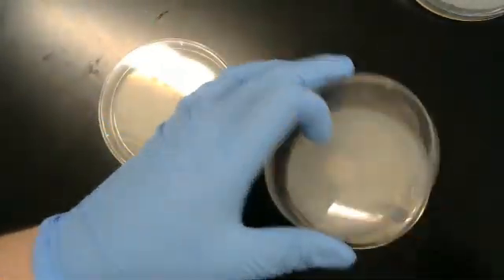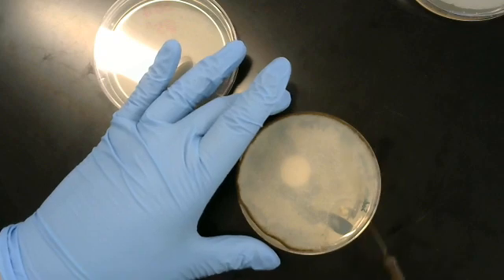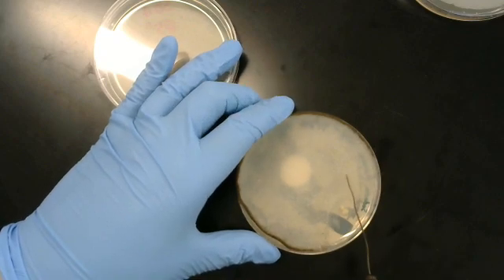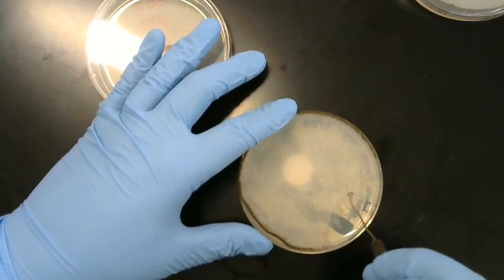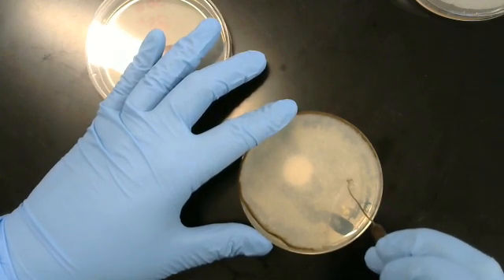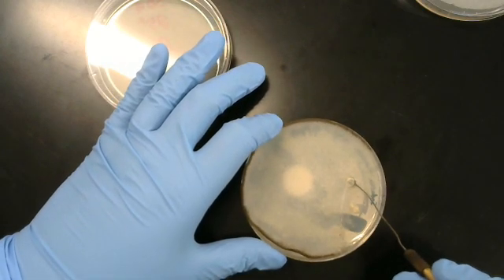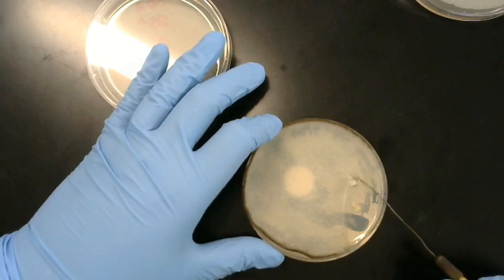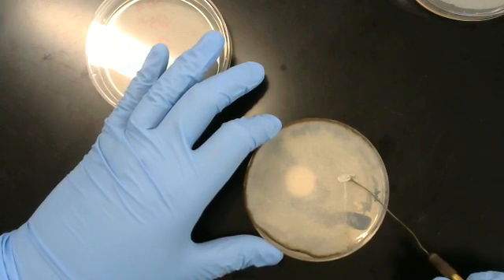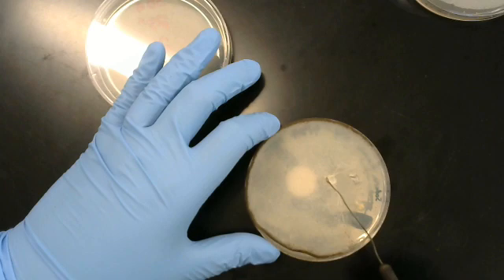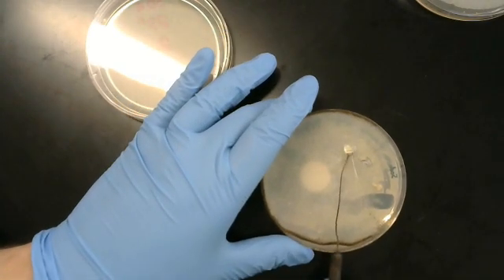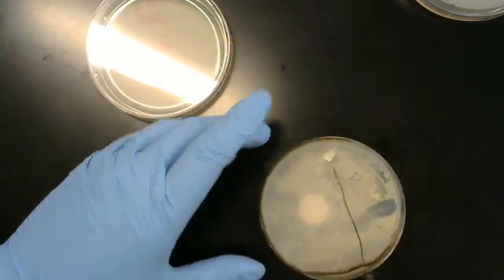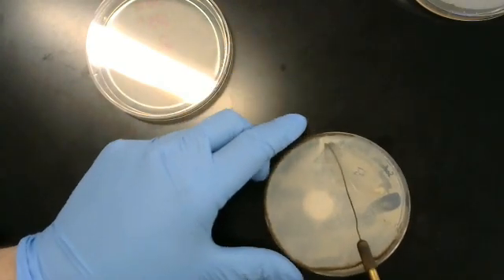Same thing as before, pop this off, see the growth. And we are going to cut into the agar right like this with our loop. And bring out... just not exactly the easiest technique to do, especially when your chunk of agar gets caught in more fungi.